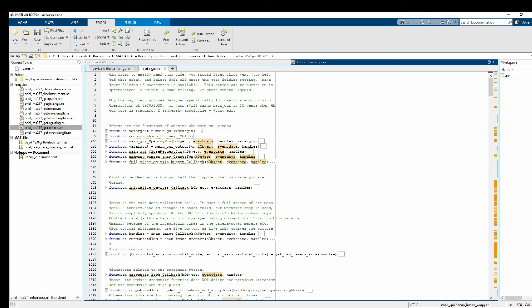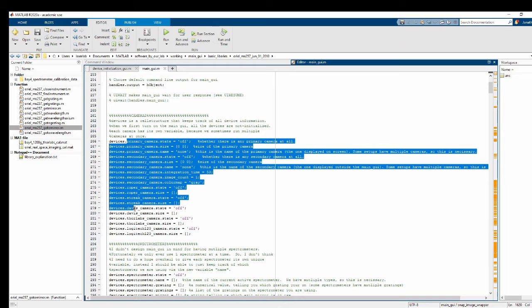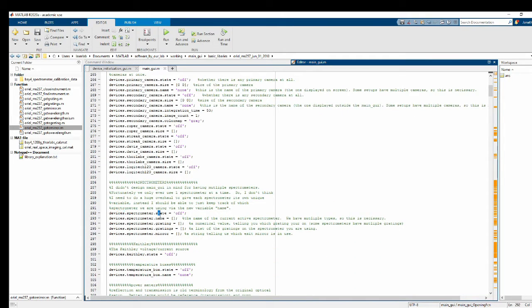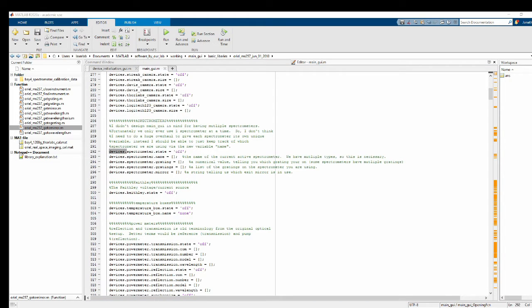And I'm going to scroll up here to the opening function, and you can see all the different devices have various properties stored. So the spectrometer has a state, a name, a grating, a gratings. Grating is a numerical value, gratings is a cell of strings, and the mirror saying which exit is being utilized. And what we're going to do is add in another field to this device's structure, which will correspond to our white light filter. So now I've already typed all that out, so let me just copy and paste that over here.